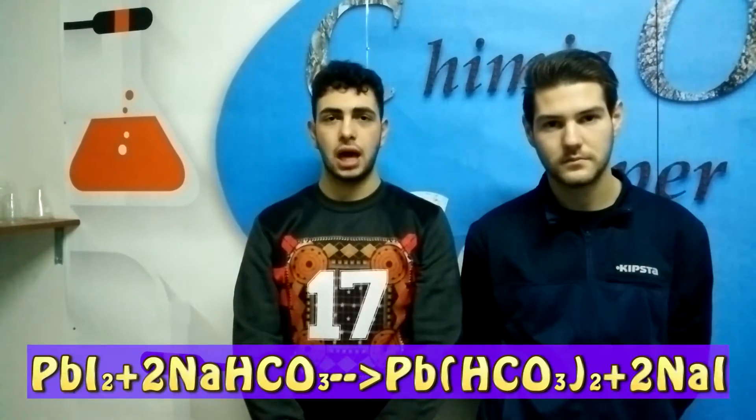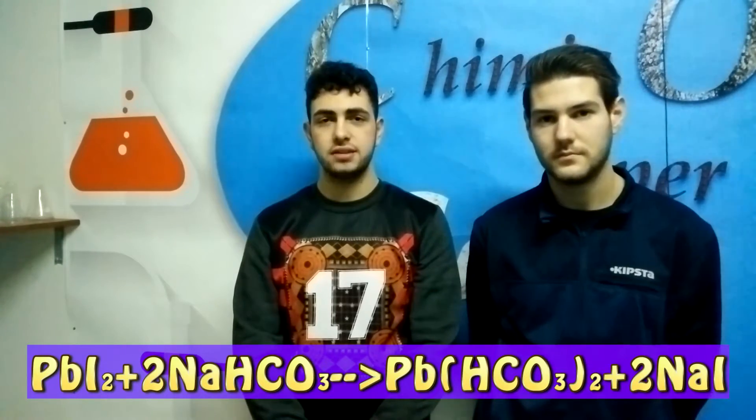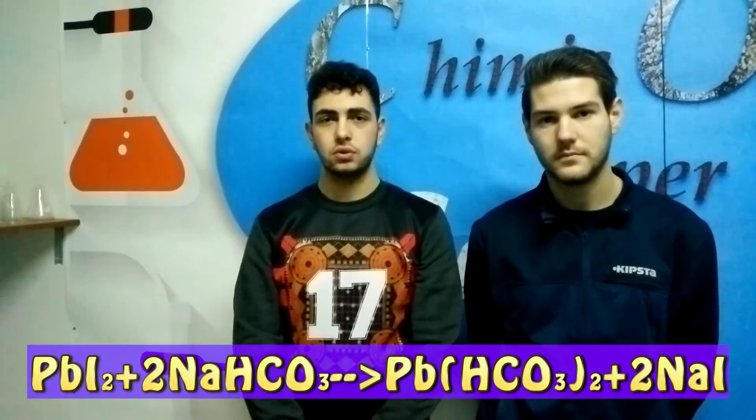The experiment is over and we want you to know that in this experiment we produce lead salts and you have to use gloves because they are toxic and can also be dangerous. Also, when you wash everything, including your recipient, you have to use baking soda because a reaction happens in which lead hydrogen carbonate is formed, and this particular salt is really insoluble in water and you have to wash it away.